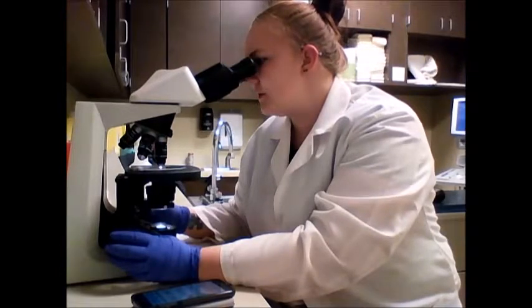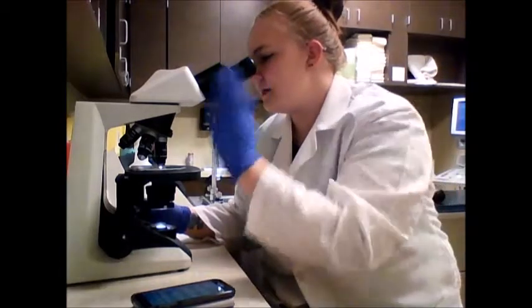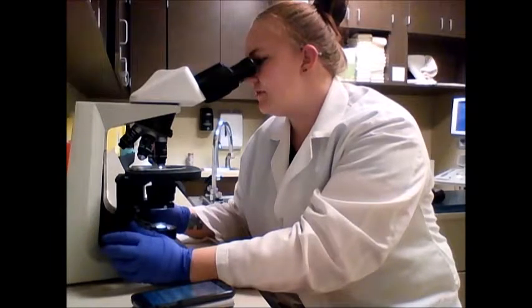I kind of go in a sweeping motion, up, across, down, across, up, as far as that goes, just to make sure I'm getting everything.